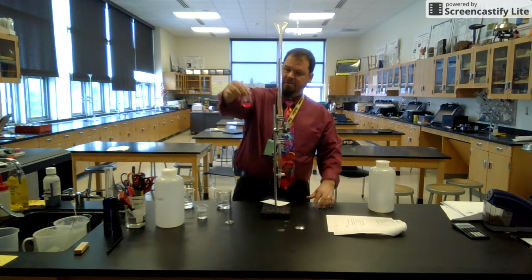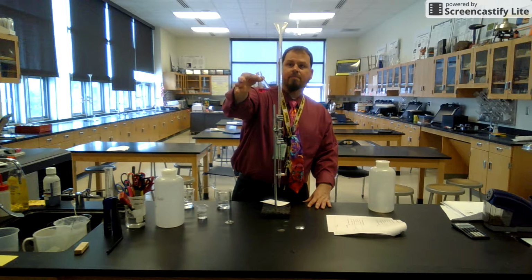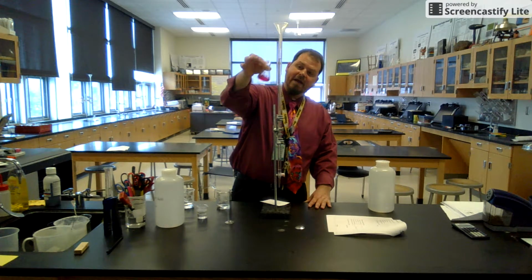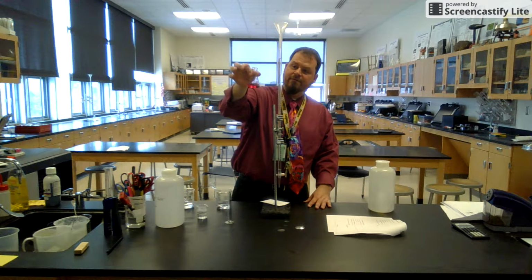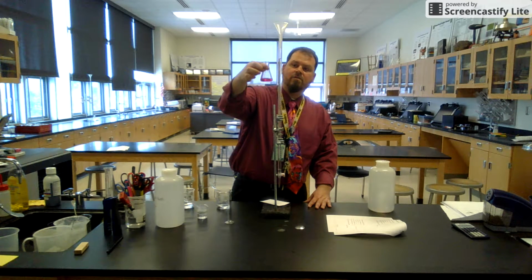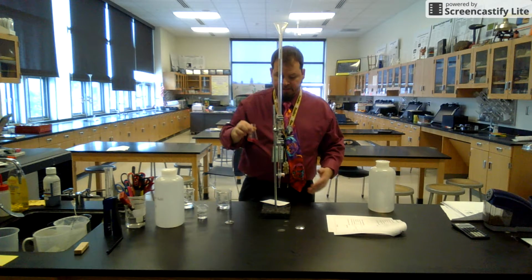So here we go. I have reached my endpoint. As a matter of fact, I've blown way past the endpoint. And I didn't use very much base. So you should know right off the bat that you're not going to have to use very much base. Okay, so if this was my first run, I would probably dump this in the waste beaker, rinse this particular Erlenmeyer out, and do it again. You're going to repeat this 3 times.